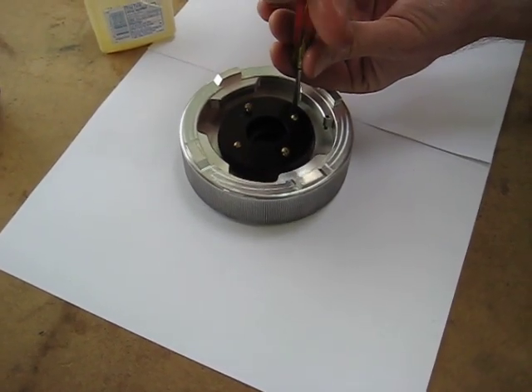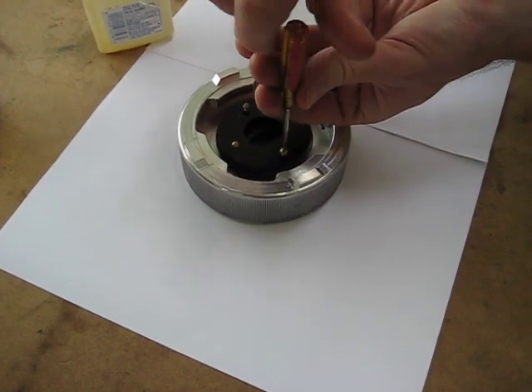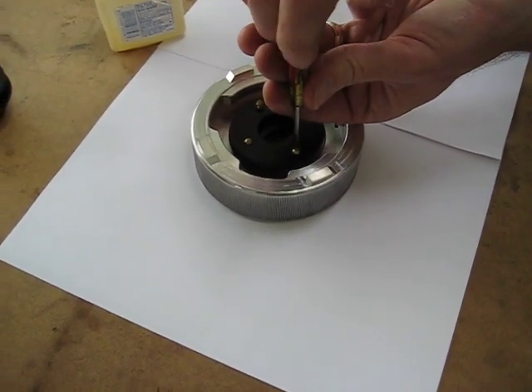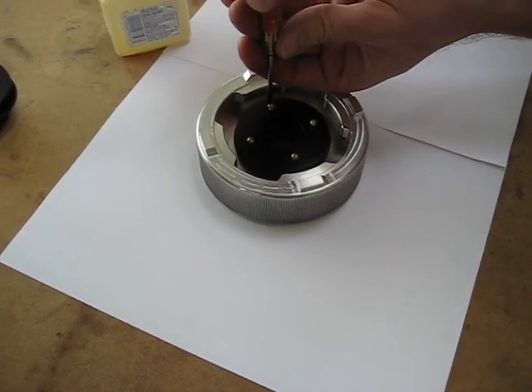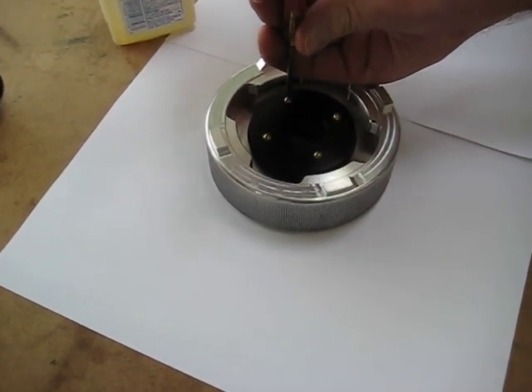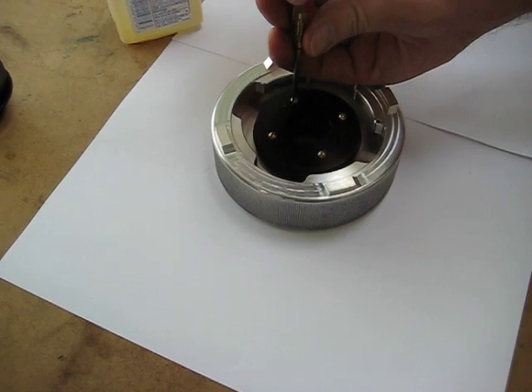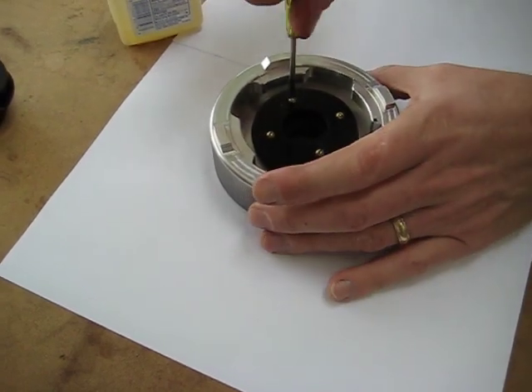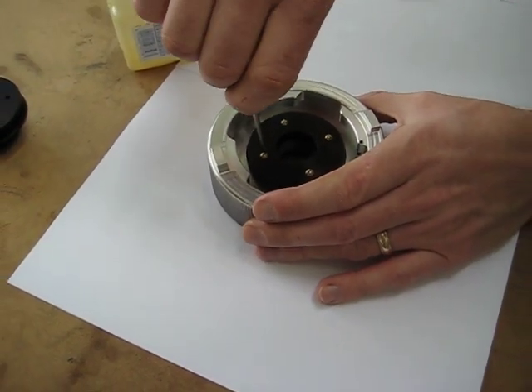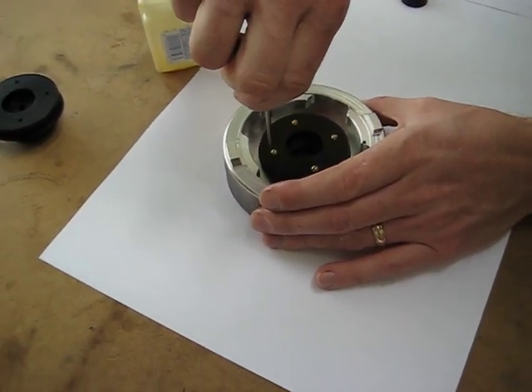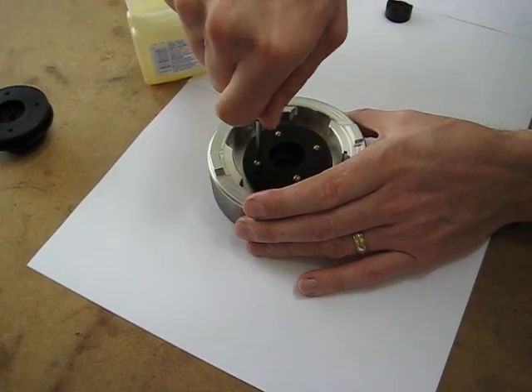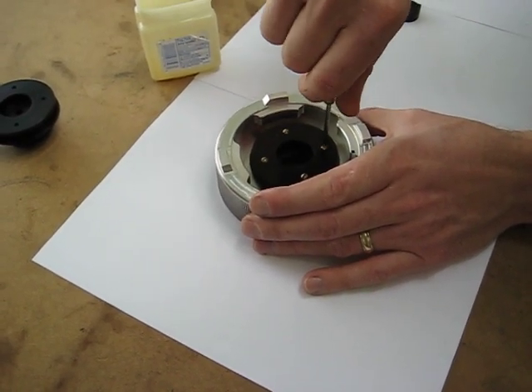These only have to be a little more than finger tight. The pressure from the chamber actually makes the seal against the rubber, and the screws are just holding the insert in place. It helps to lift the lid just a tiny bit at the very end. Make sure that all four screws have been properly seated.